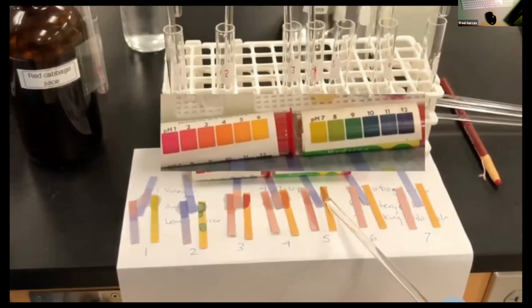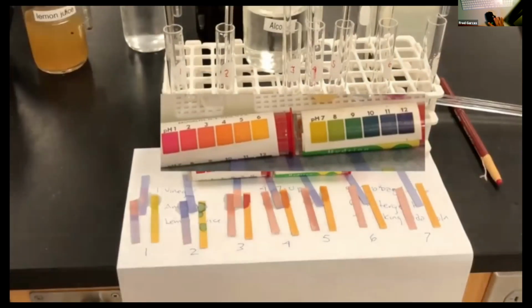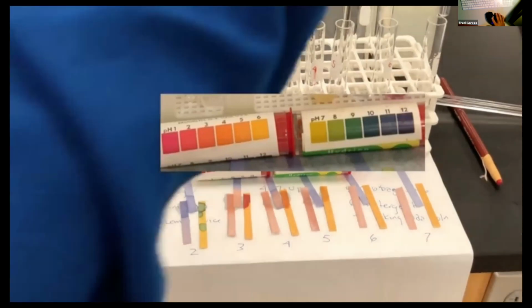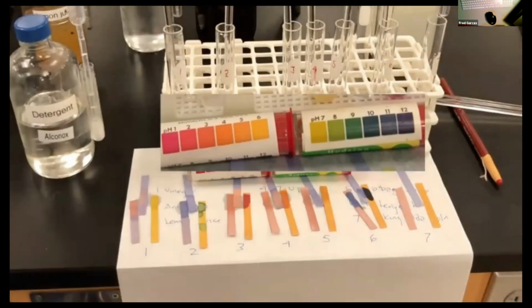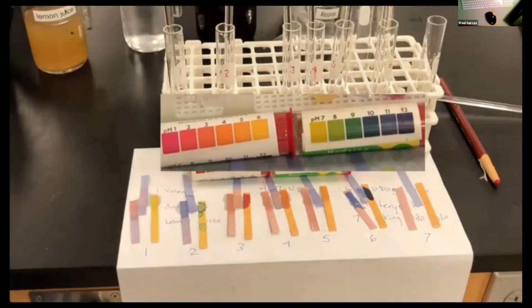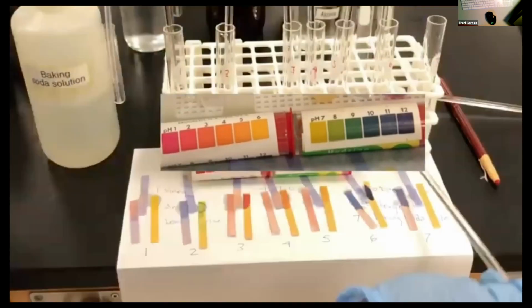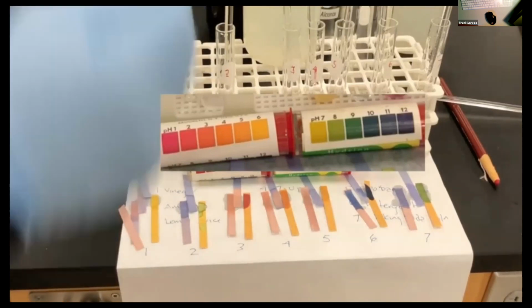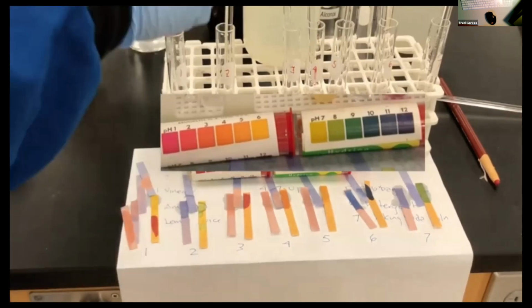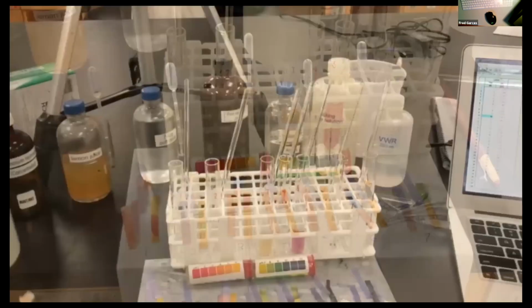And now you could pretty much estimate just based on the litmus paper. Notice that there is red litmus and blue litmus, and then hydrion. Red litmus and blue litmus will tell you whether it's acidic or basic, and then the hydrion will tell you approximately what the pH is. So I go through all 7 solutions. And now just based on the color, you should give an estimate of what the pH is for each one of these. First one is vinegar, second one's ammonia, third one is lemon juice, fourth one is 7-Up, fifth one, well, you can see that.